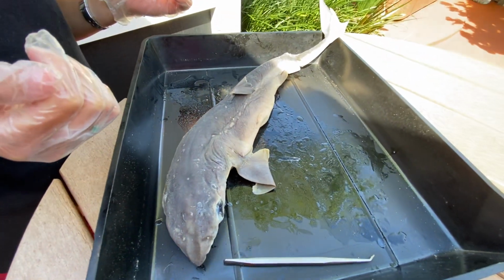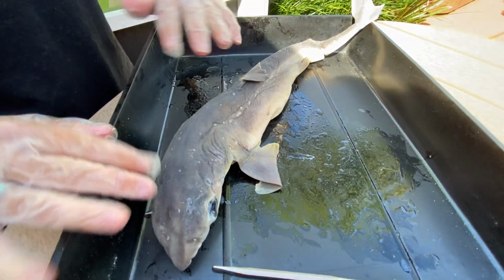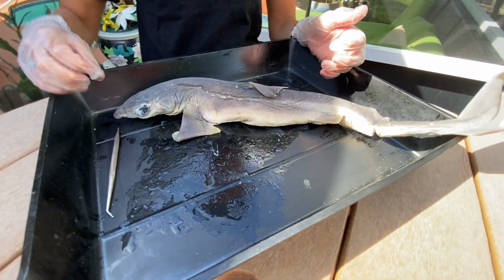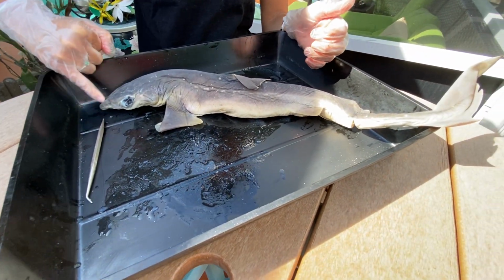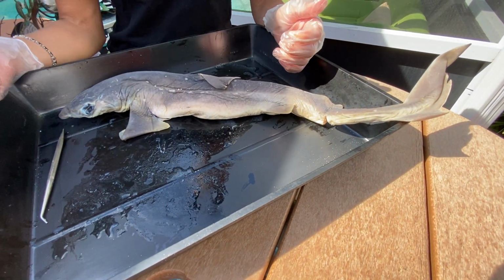All right, also what you can notice is the shape of the shark. Sharks are all very, very streamlined. Fish and sharks have different terminology. For a streamlined body plan, it is called fusiform. And a fusiform body plan is nicely tapered. This is called the rostrum. It is a tapered rostrum, and it really allows a nice efficiency to slip through the water.